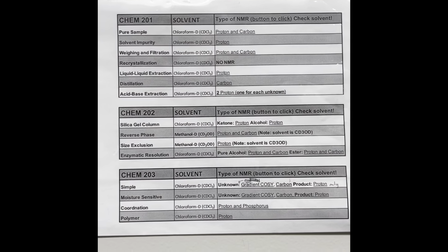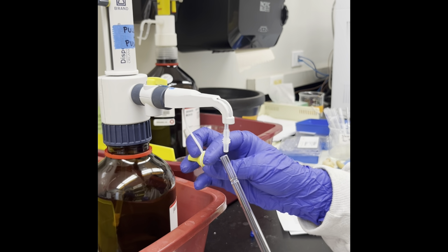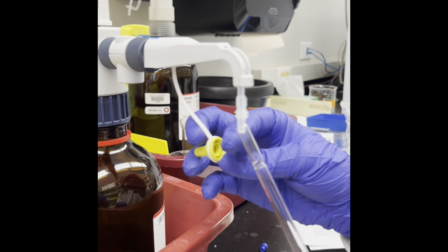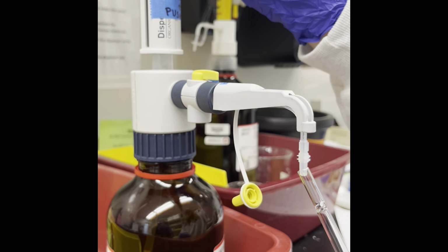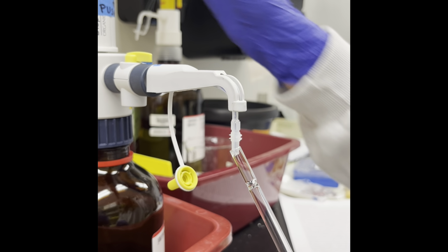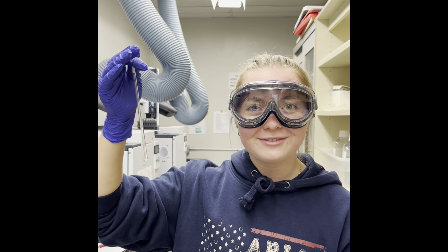To dispense the solvent, remove the cap from the spigot and place your pipette directly under the spout. Go ahead and pull the top of the bottle and push it down to dispense the correct amount of solvent. How do I know if I've used enough solvent?